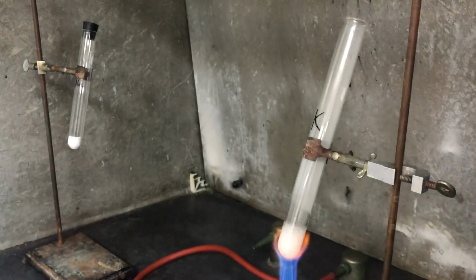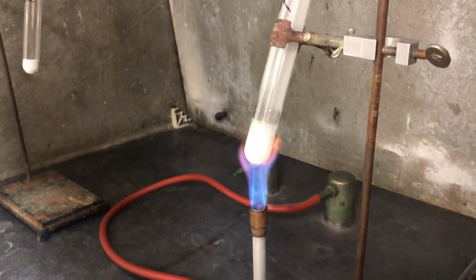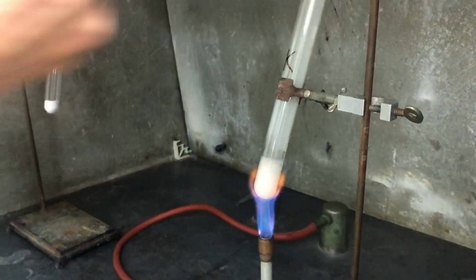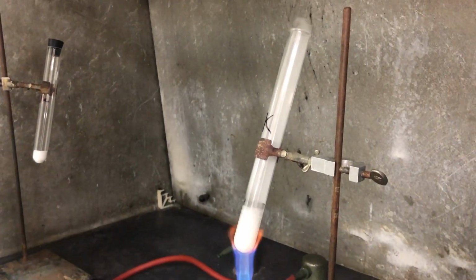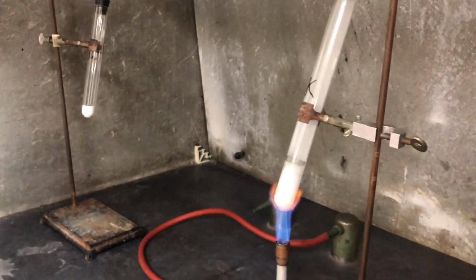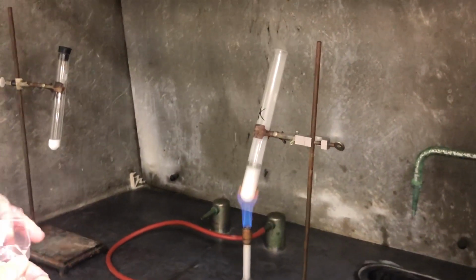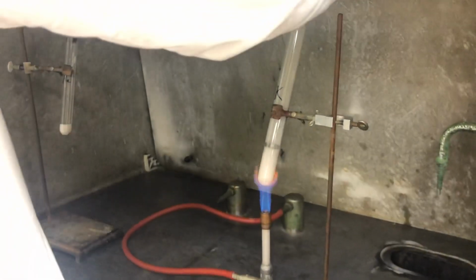All right, so let's see what we got here. Okay, when this, see there? We got pure oxygen there now. All right, so I'm gonna take one of these capsules. Now we'll close the shield because we don't really want this to come back on us, and turn the vent hood on. It should glow pretty vigorously.